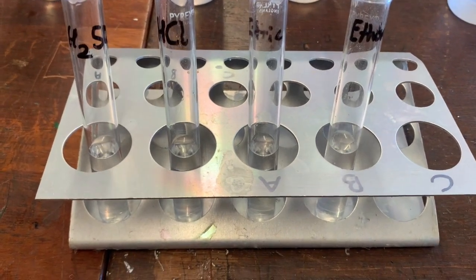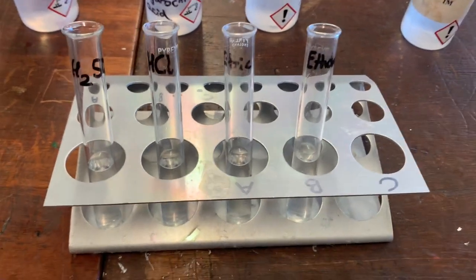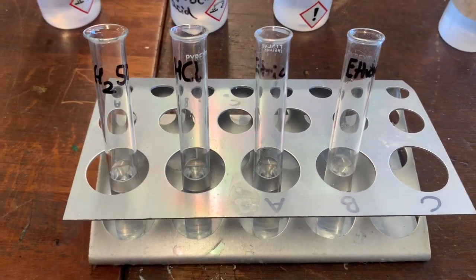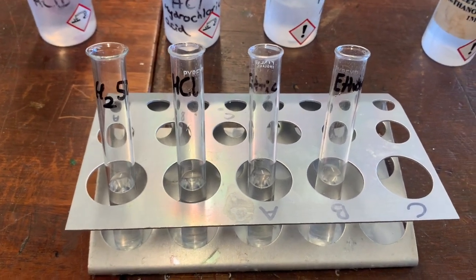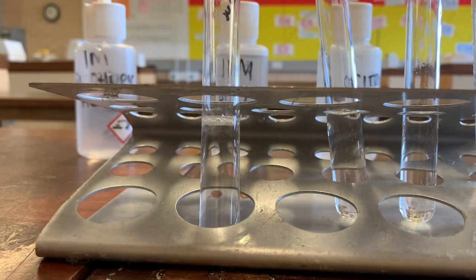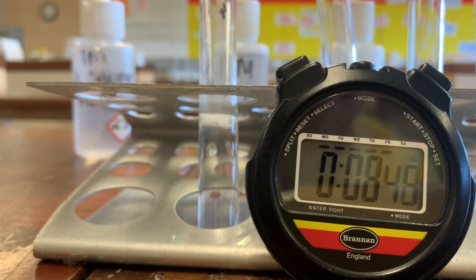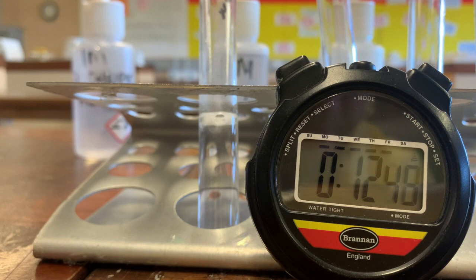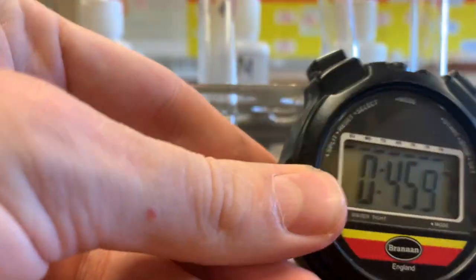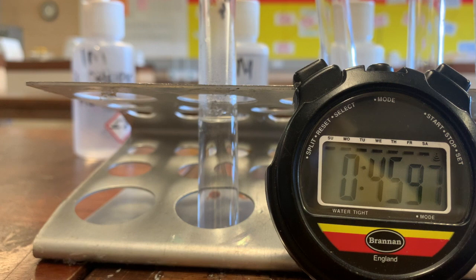The same volume of each acid has been added to these test tubes, and I'm going to add some magnesium, which reacts with acids. The stronger the acid, the quicker the magnesium will react. So let's find out which of these acids is stronger by how long it takes the magnesium to dissolve. Let's start with the sulfuric acid — I'm just going to put this in now. You can see that it's bubbling quite vigorously. And I think that's finished — that took 45 seconds, nearly 46 seconds in fact.